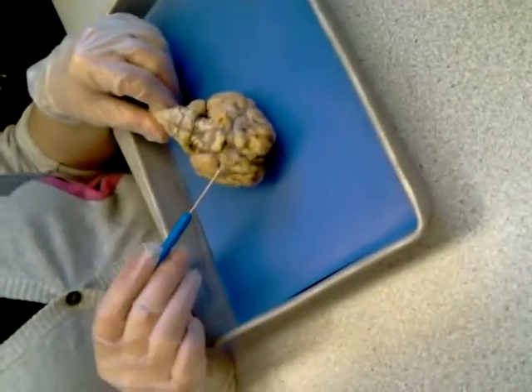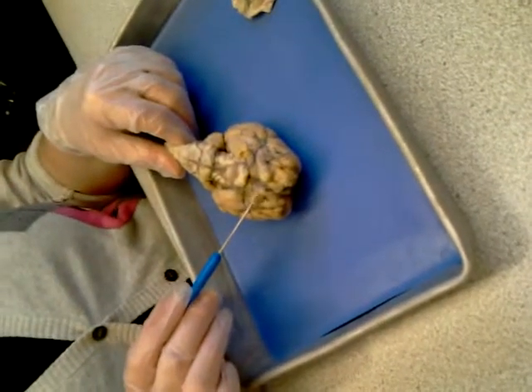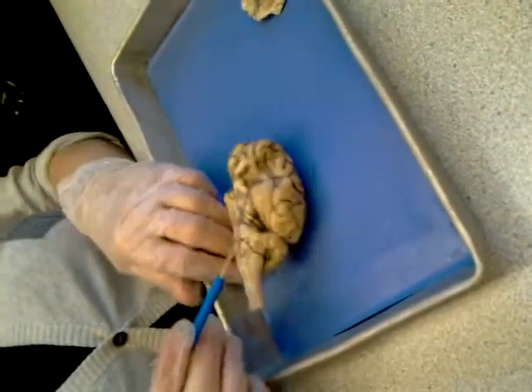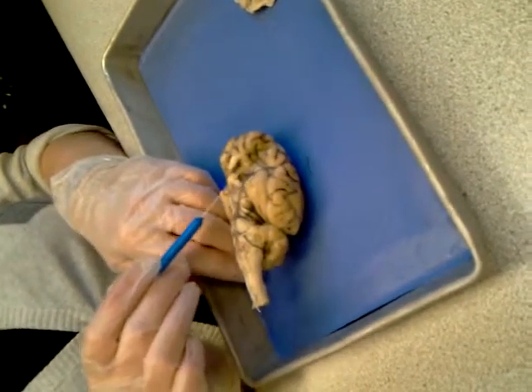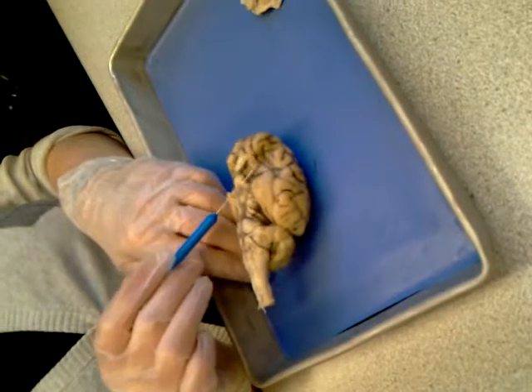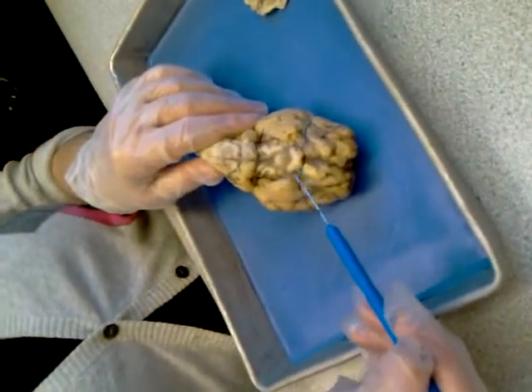Going over to the ventral view. What are these structures right here? The bulbs. And what nerve is found within? Olfactory nerve. Okay. How about this tract right there? What is that called? Lateral olfactory tract. Lateral olfactory band or olfactory tract? Good. How about this nerve right here?